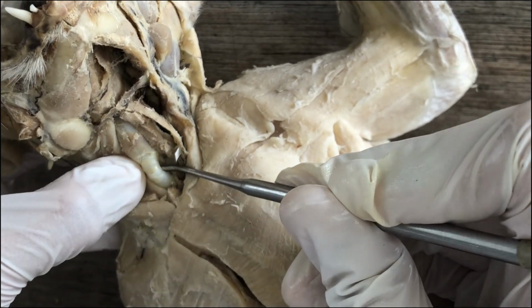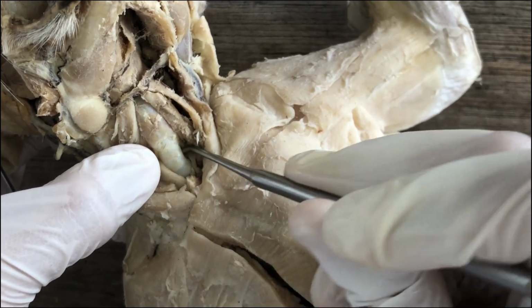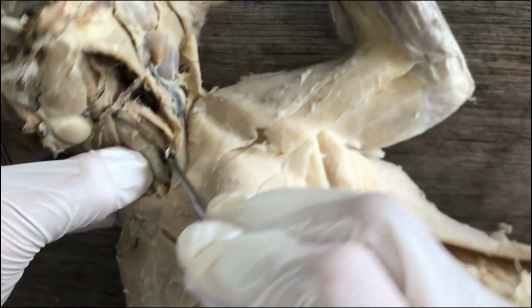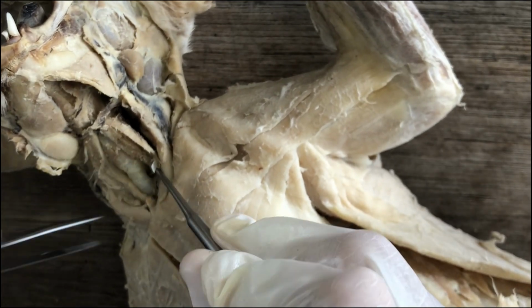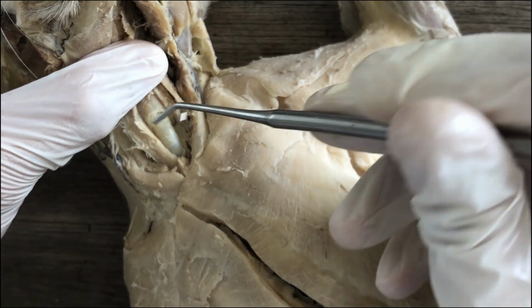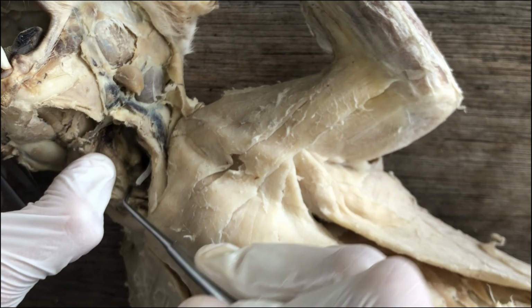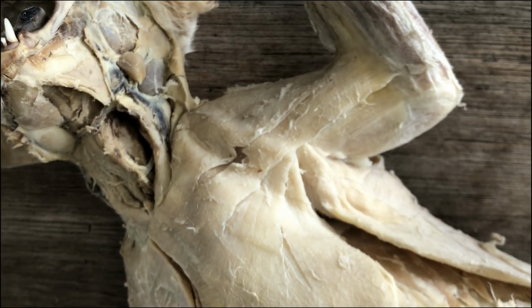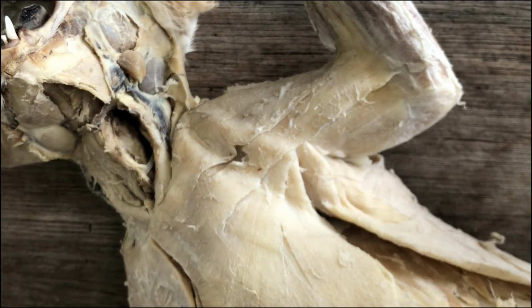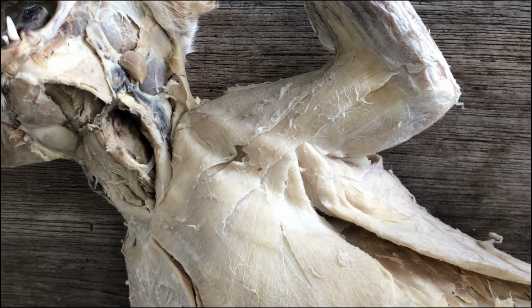But what's interesting is that the trachea, although it is reinforced by rings of cartilages, it is incomplete. Right? On the dorsal aspect of the trachea, there's no cartilage. And that's because at the backside of the trachea is the esophagus. And so it's beneficial not to reinforce the backside of the trachea in order for the esophagus to expand when you're swallowing.